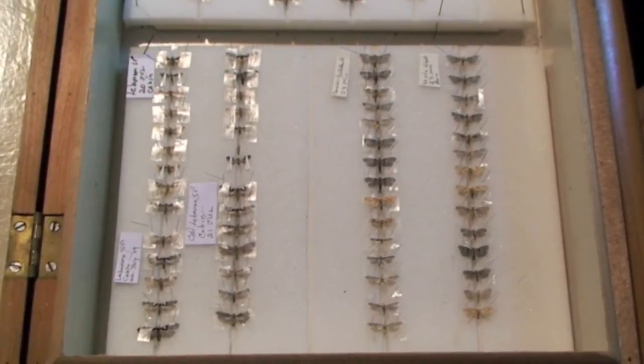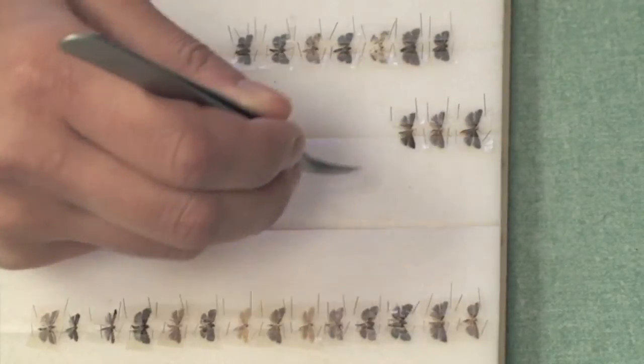The pinned specimens should dry for five to six days. After drying, the paper holding the wings is removed from the specimen.